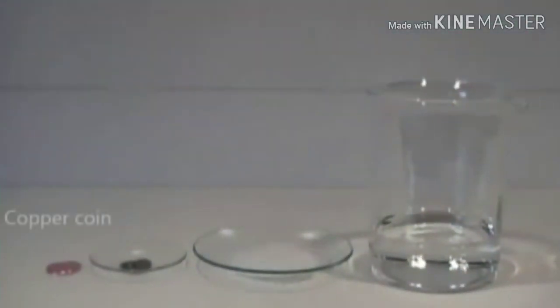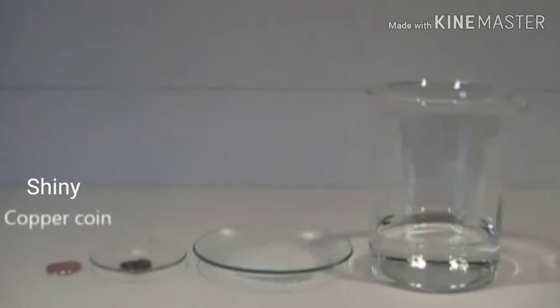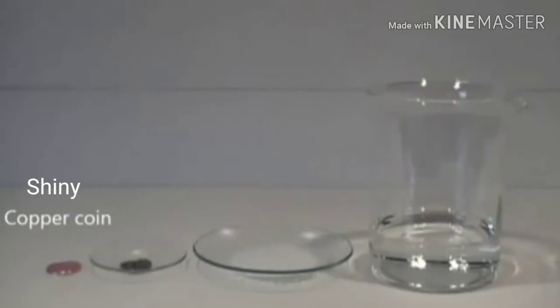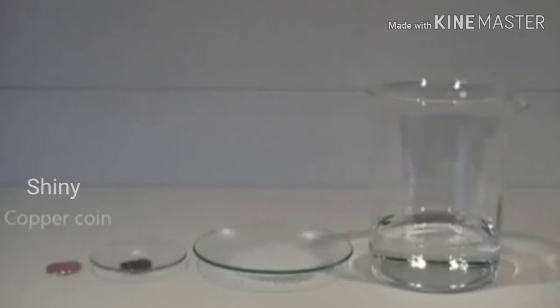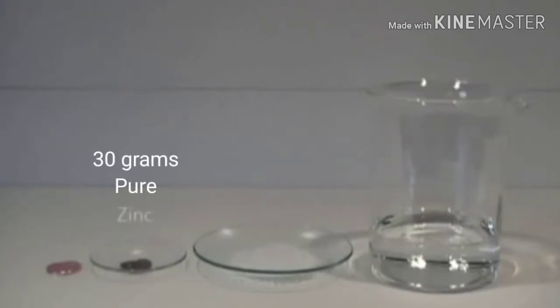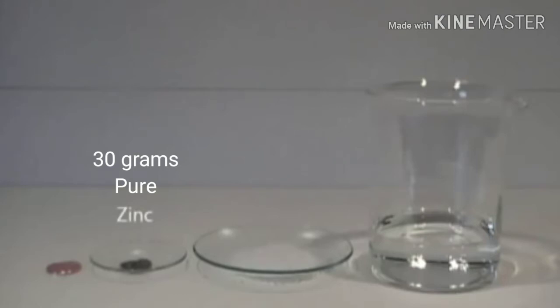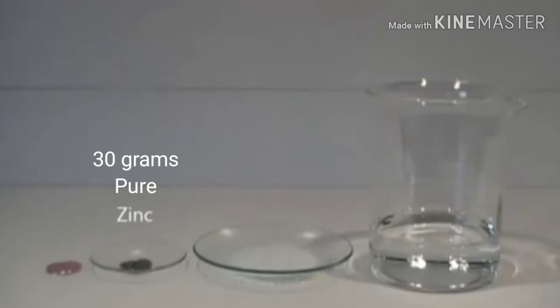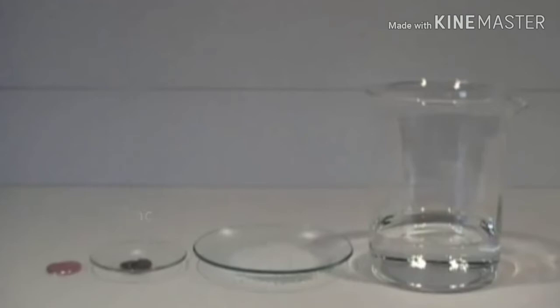For this experiment, I needed some pennies — the shinier the better. I prepared enough chemicals to do a batch of 40 at one time. Dimes, nickels, and quarters won't work unfortunately; we need pennies because pennies are coated in copper. The next thing I needed was 30 grams of pure zinc — not zinc oxide, pure zinc the metal. Either powdered zinc or zinc granules will work. Powdered zinc tends to work a little faster, but granules are fine too.